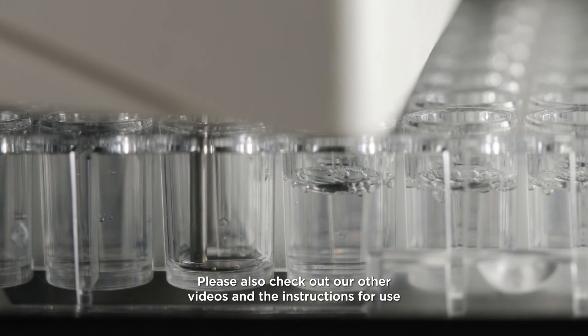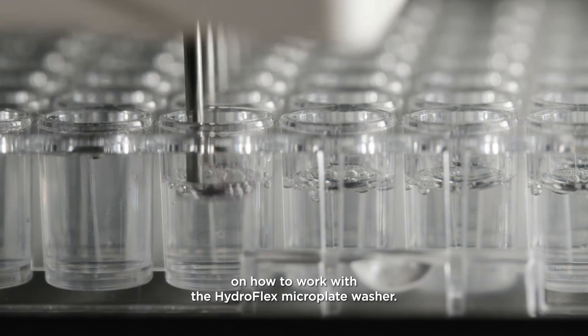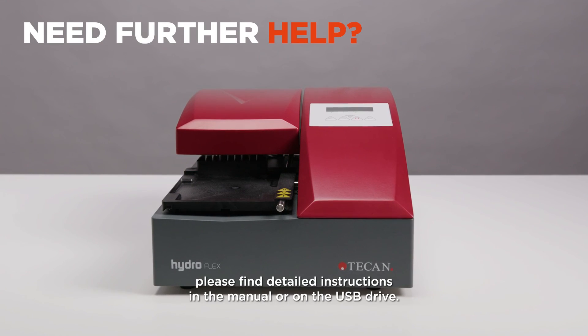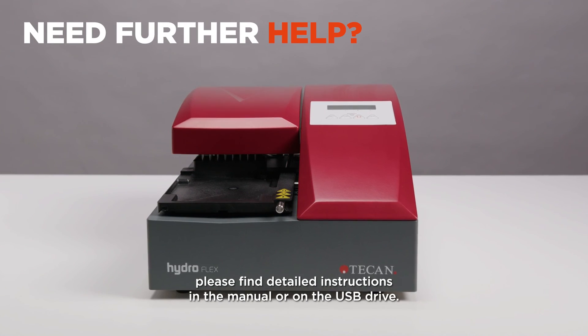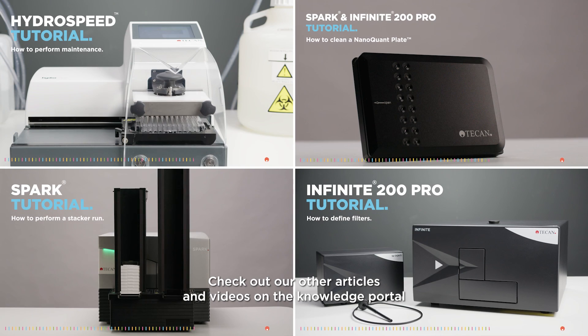Please also check out our other videos and the instructions for use on how to work with the HydroFlex microplate washer. If you need any further help, please find detailed instructions in the manual or on the USB drive. Check out our other articles and videos on the Knowledge Portal, and please do not hesitate to reach out to our helpdesk experts.